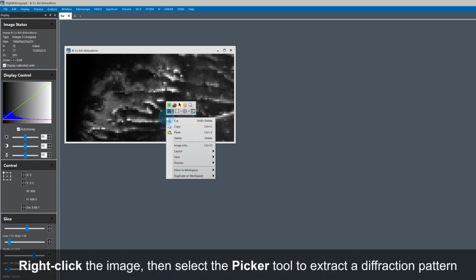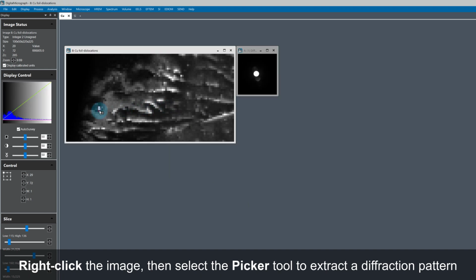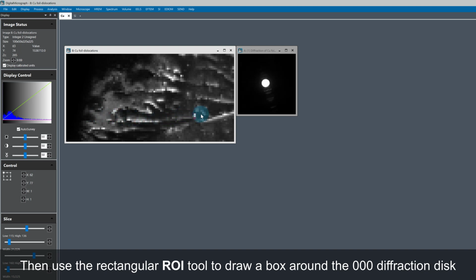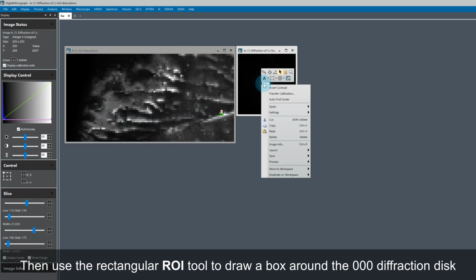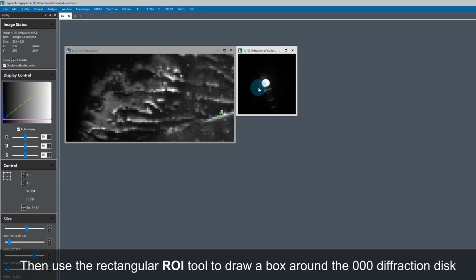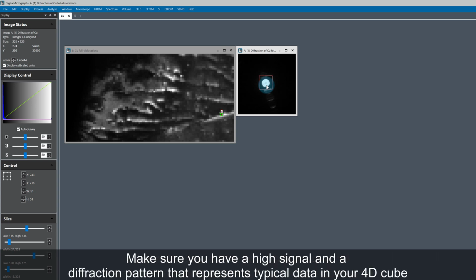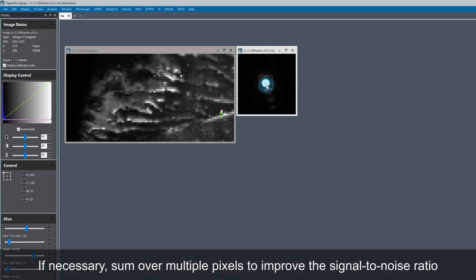Start by using the picker tool to extract a diffraction pattern from the 4D STEM data. Now use the rectangular ROI tool to draw a box around the 000 diffraction disk. The extracted diffraction pattern will be used as a reference for a drift measurement and alignment by cross-correlation. So make sure you have high signal and the diffraction pattern is typical and representative of the dataset as a whole. If necessary, sum over multiple pixels to improve the signal-to-noise ratio.